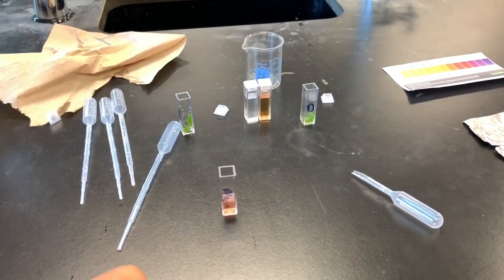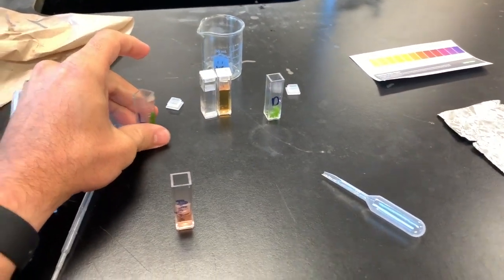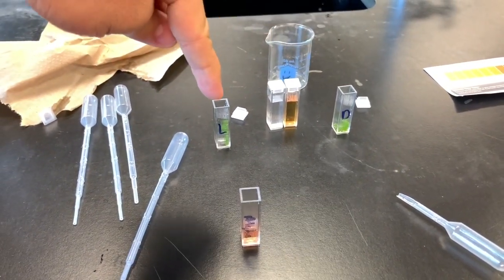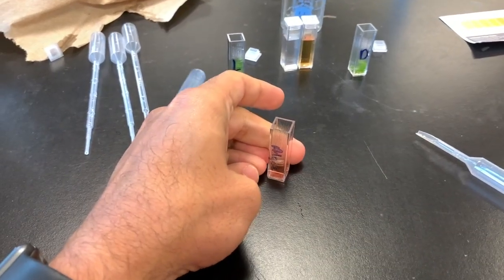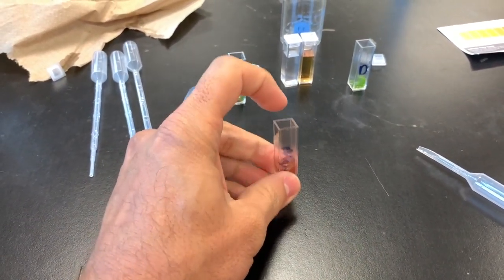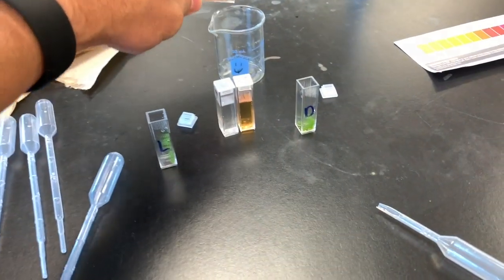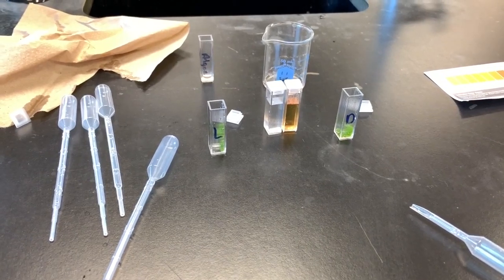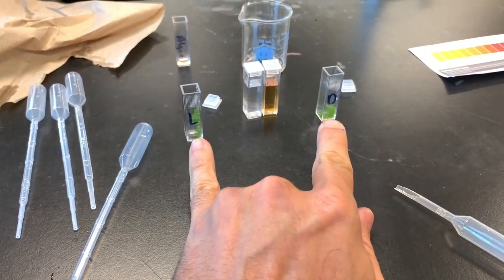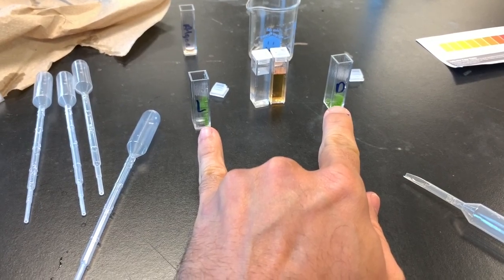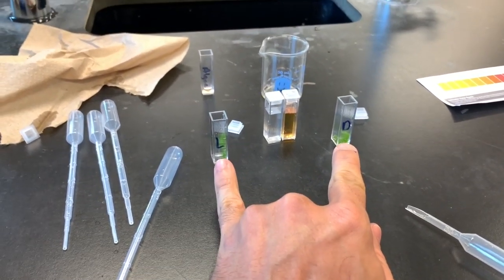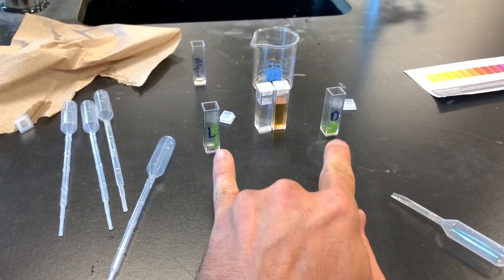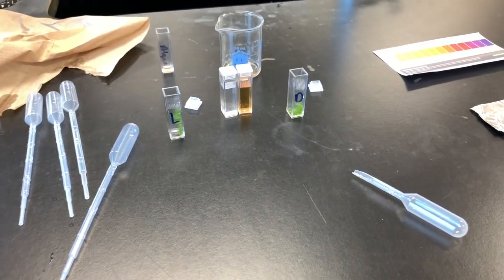After you have, you can see I have placed 10 algae beads into each, the dark and the light. And then where the algae beads used to be, this is this excess, and this is what you're going to put in your waste container. Once you put these in here, you got to be careful, and if for some reason you don't have 10 of each, let me know, I can get you some more algae beads, but there should be 10 in each one. Just be careful when you're handling them, you don't want to break the algae beads.